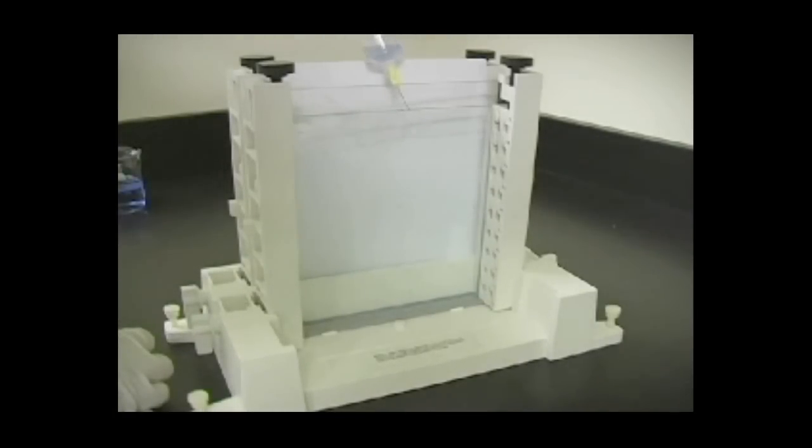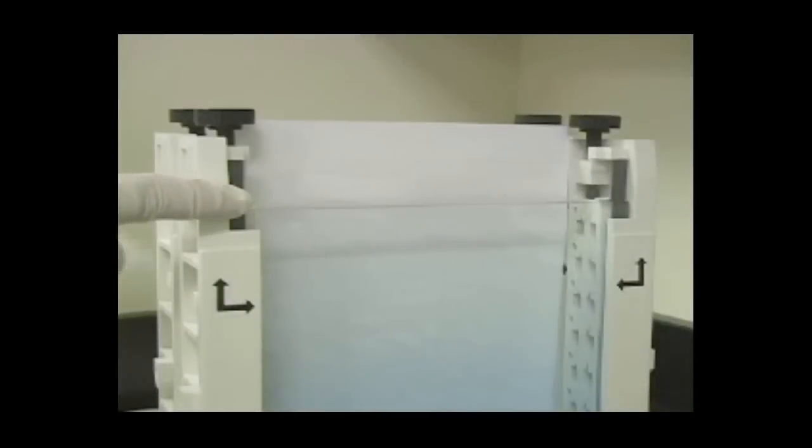If using an IPG comb, the level of the acrylamide should reach the top of the short plate.